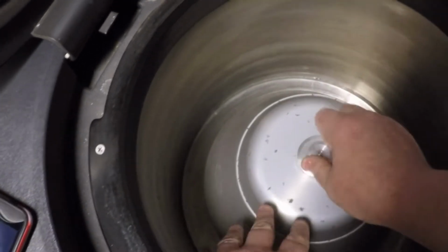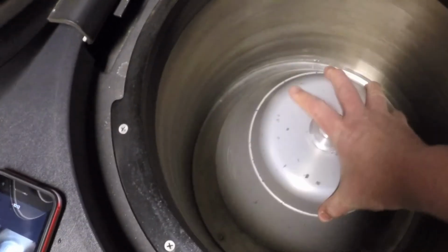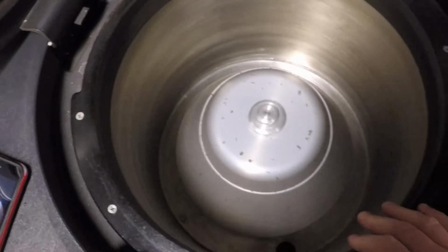So you turn it again, this time to the left. Did it correctly this time. And there she's nice and solid. Okay, this top is not loose. So we're ready to roll.